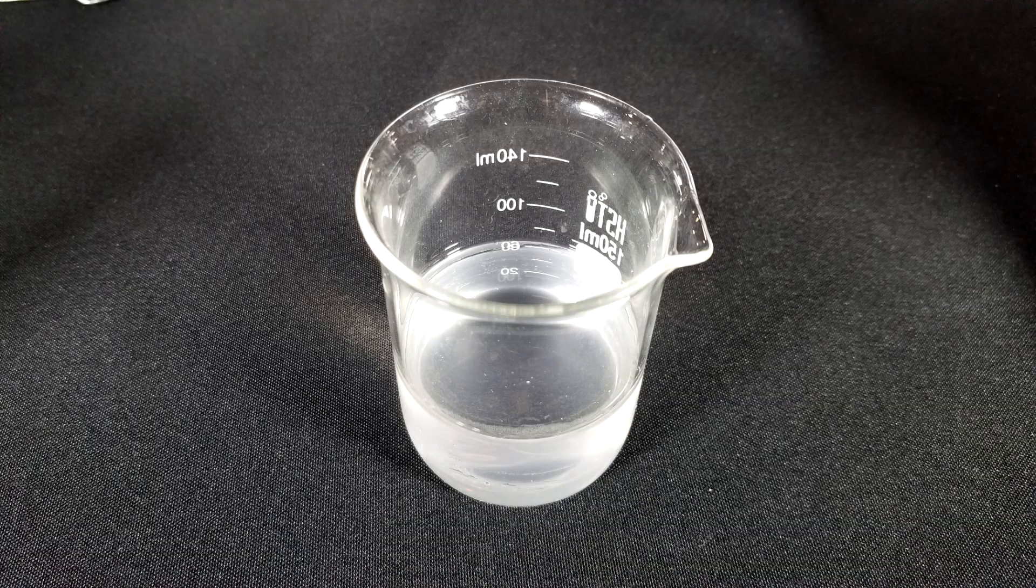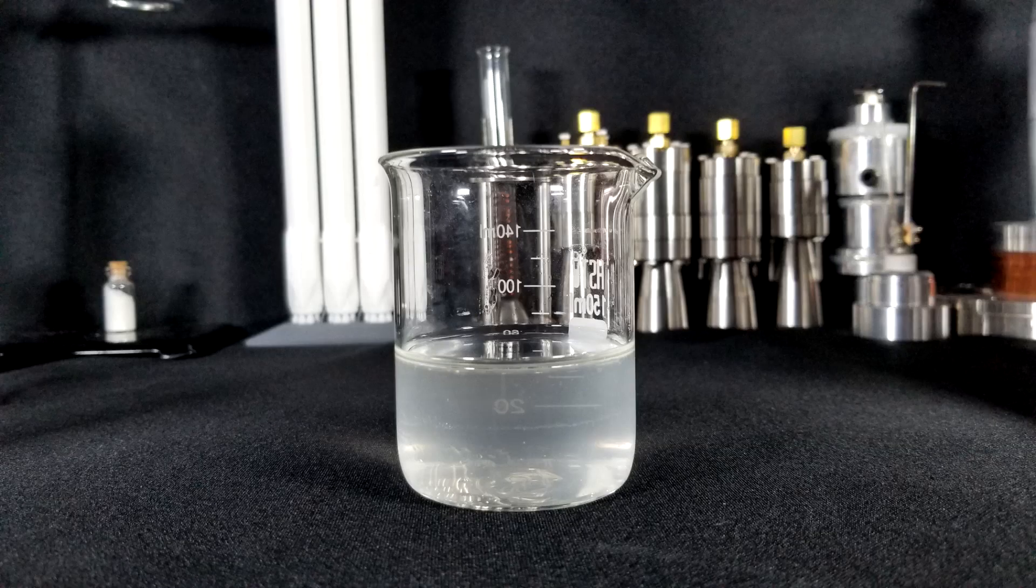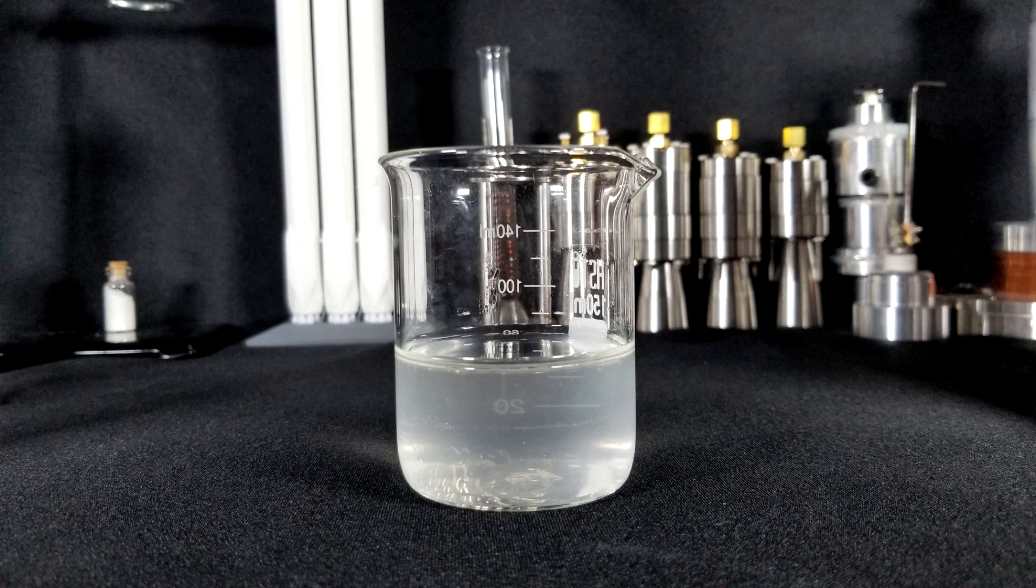After a while, we've extracted all we can. The amount of total product doesn't represent the amount of the essential oil. The majority, maybe more than 90%, would be water and other non-essential oil contents. But you can see the amount of essential oil judging by the oil layer on the top, which is definitely not a whole lot.